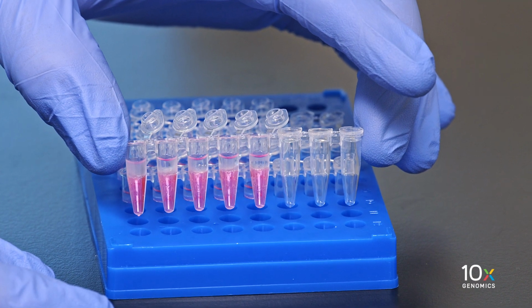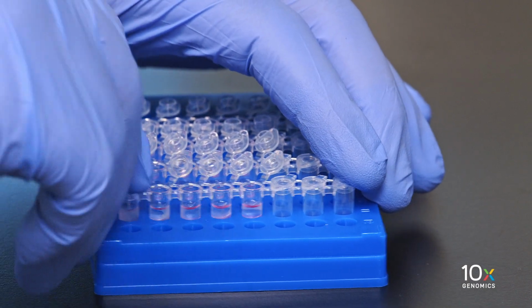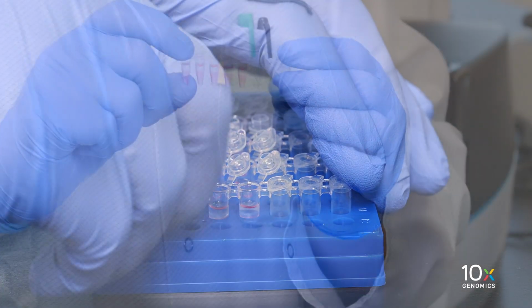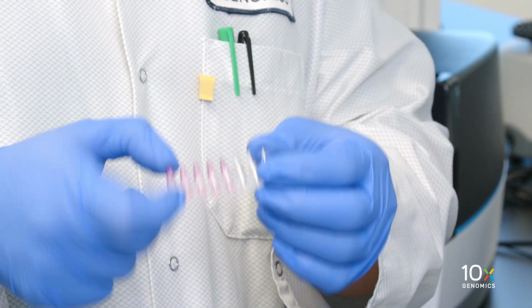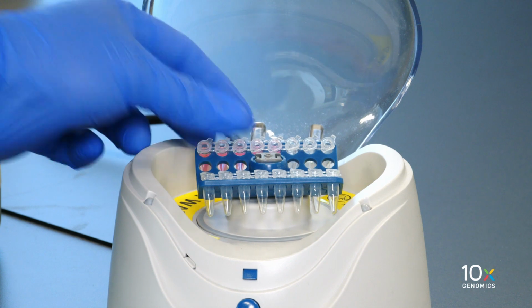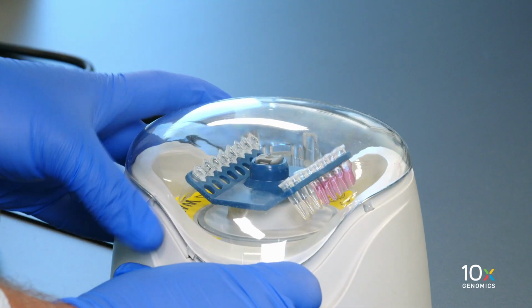If biphasic separation is incomplete, firmly secure the caps on the tube strip. Mix by inverting the capped tube strip 5 times and centrifuge briefly. Do not invert without firmly securing the caps.